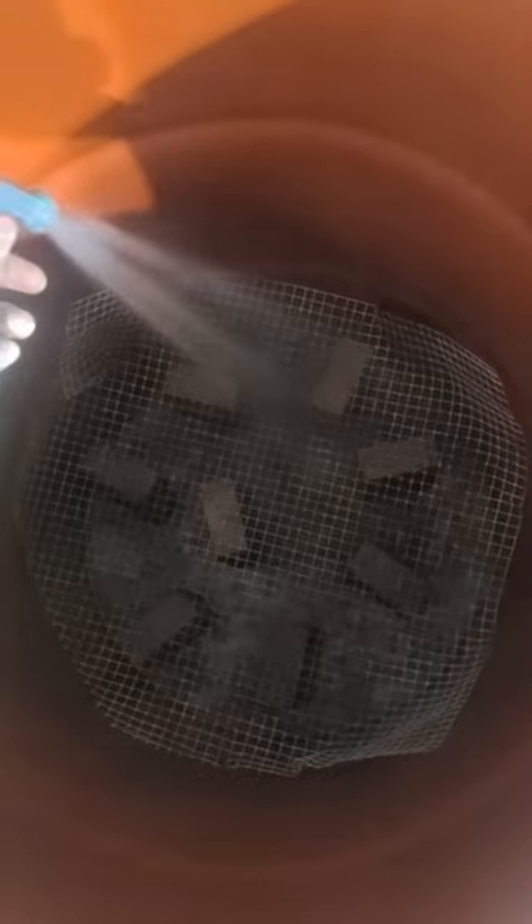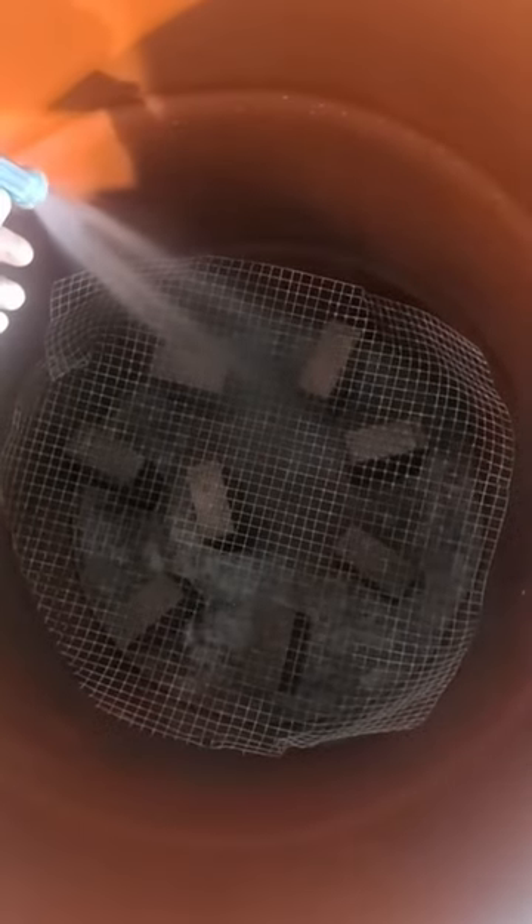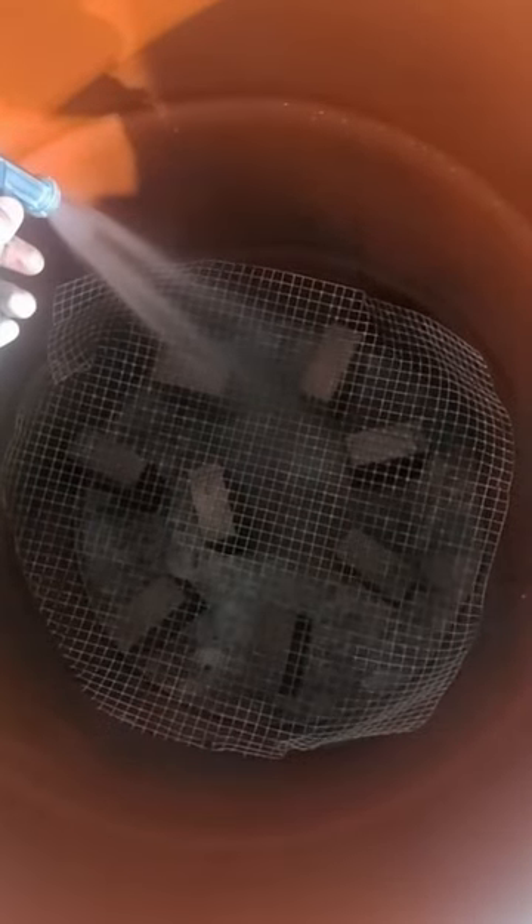There's no active control — it's simple. The water just boils and it does not boil off fast enough to be concerned about running dry. So just fill it up with water with a hose.